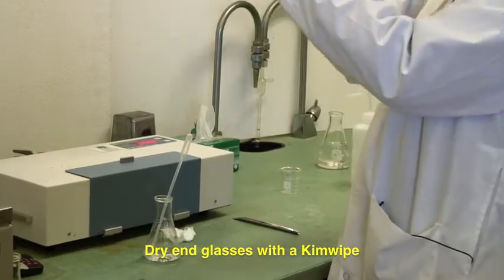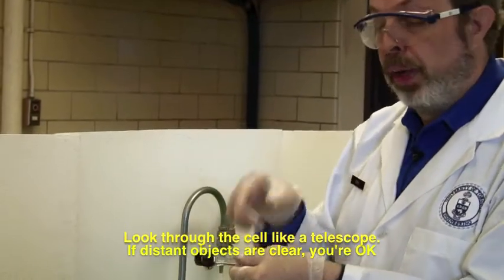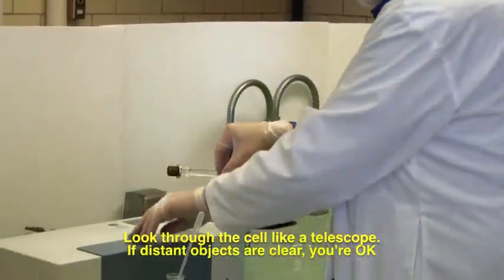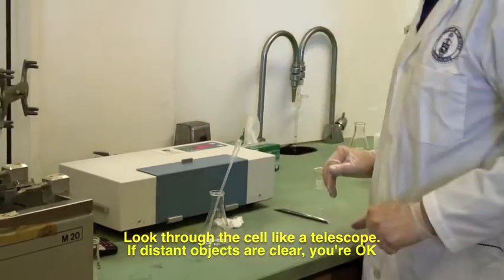Make sure that you can actually, if you look through it, you can see things rather than blurring. I'll show you that on camera in a minute. And then we put this into the container.